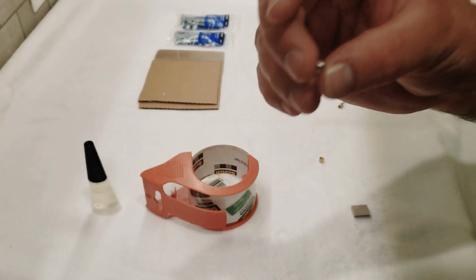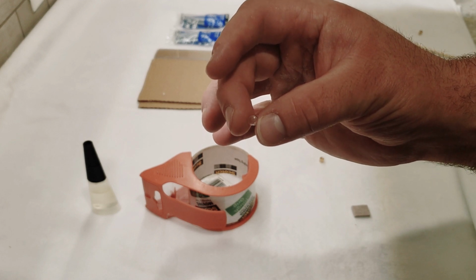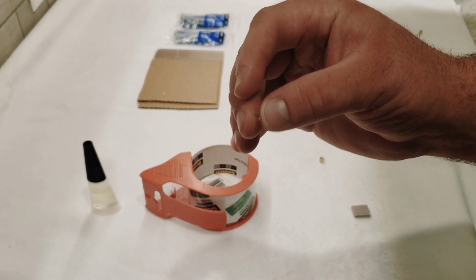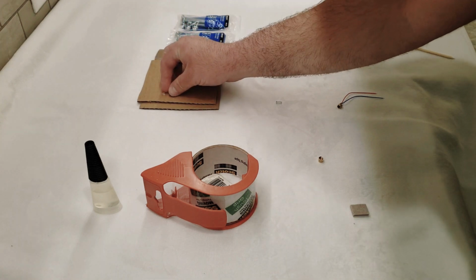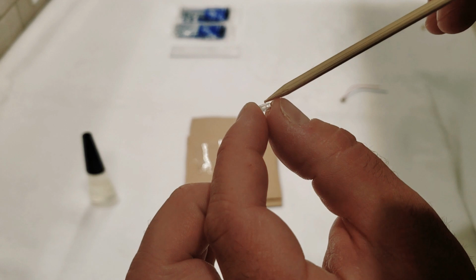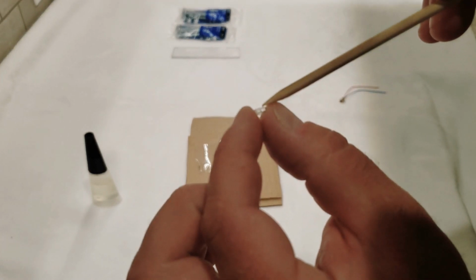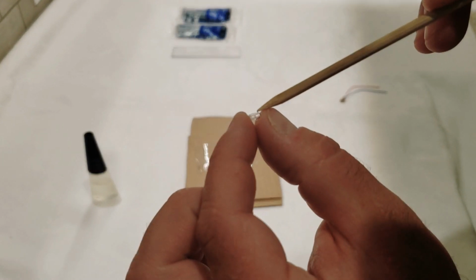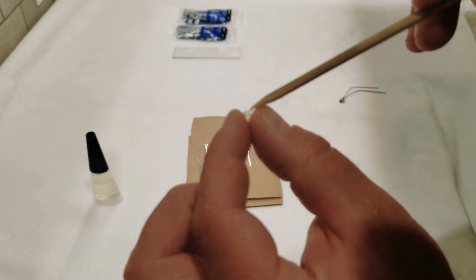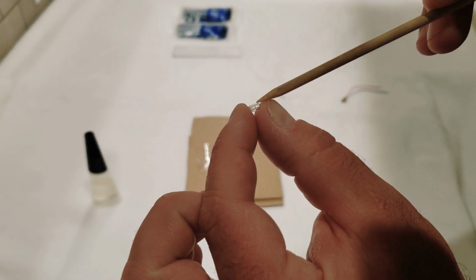Actually, one of these lenses would work just fine to put over the camera on your phone. And it would magnify somewhere around 60 times, I think. So this is the back of the lens. This is the front. This side is going to go towards the camera.